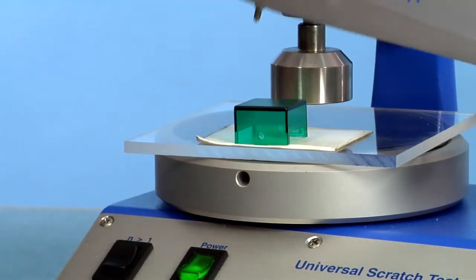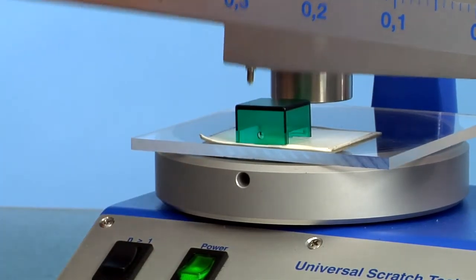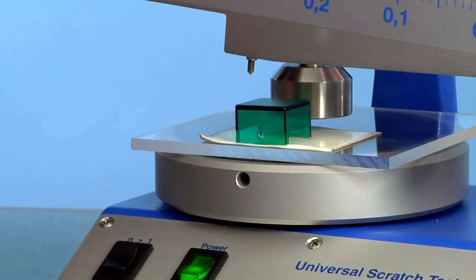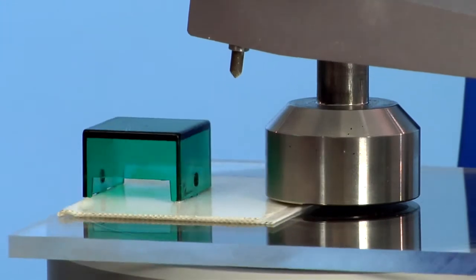Beginning at the biggest possible radius for a possibly high number of parallel scratches. As soon as the test tip has passed the sample, the scratch arm is quickly lifted up with the left hand until the rotation is fulfilled.